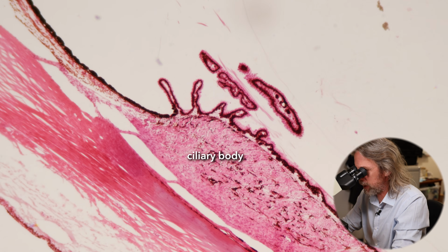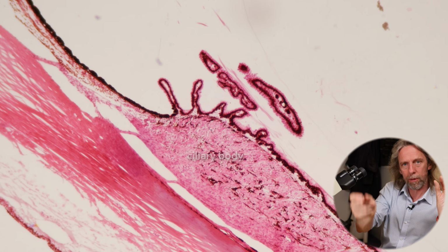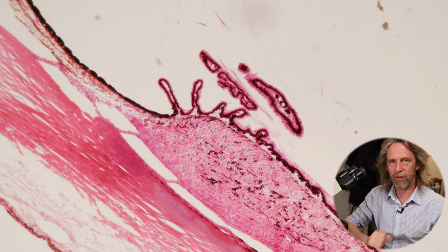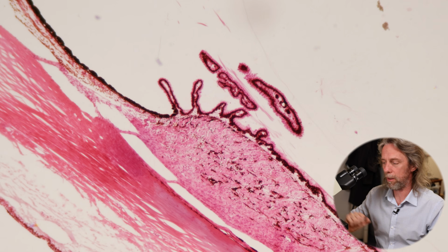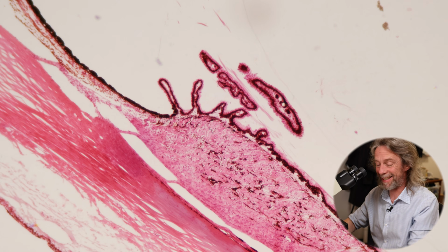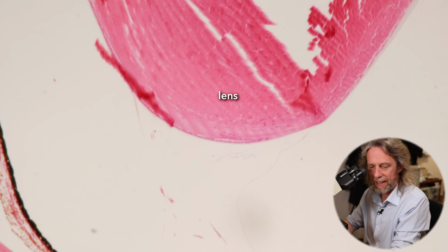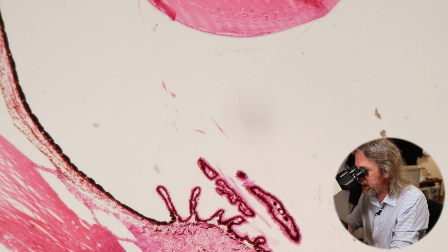This is the ciliary body. Now, the ciliary body is special because this is a ring of muscle around the inside of the eye. So it's a circular, smooth muscle. And the lens is suspended from it. So there's the lens. Can we see some little tiny fibres? We can, can't we? I don't know if I managed to focus it okay for you guys. It's a bit tricky at this power. Let's jump up to 100 times.